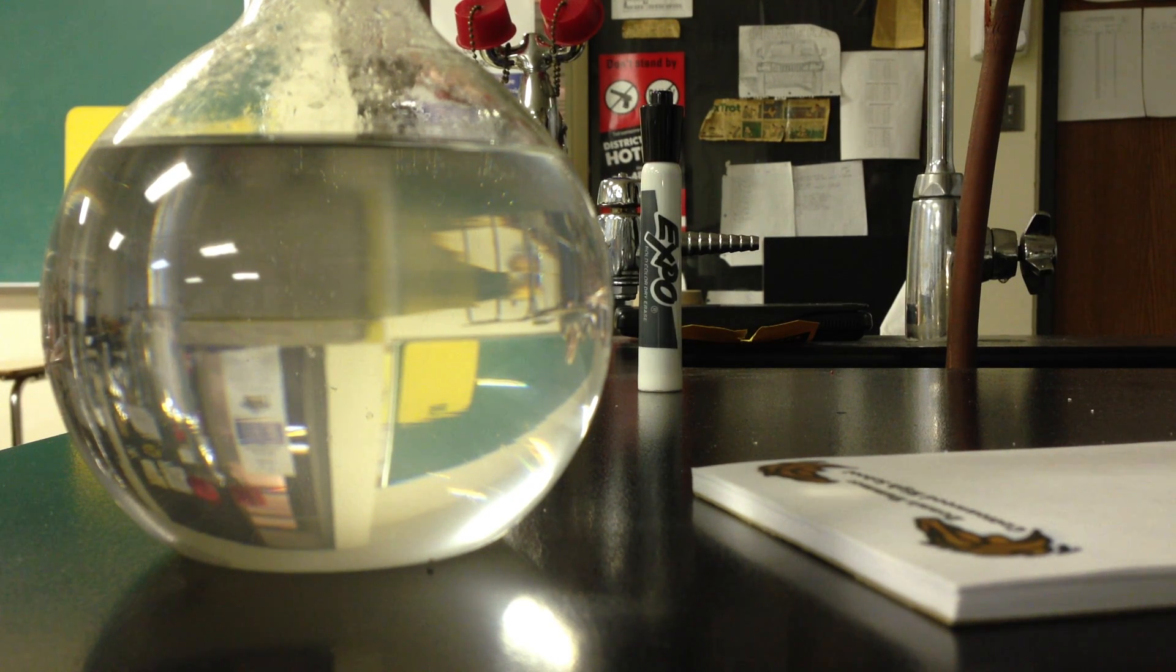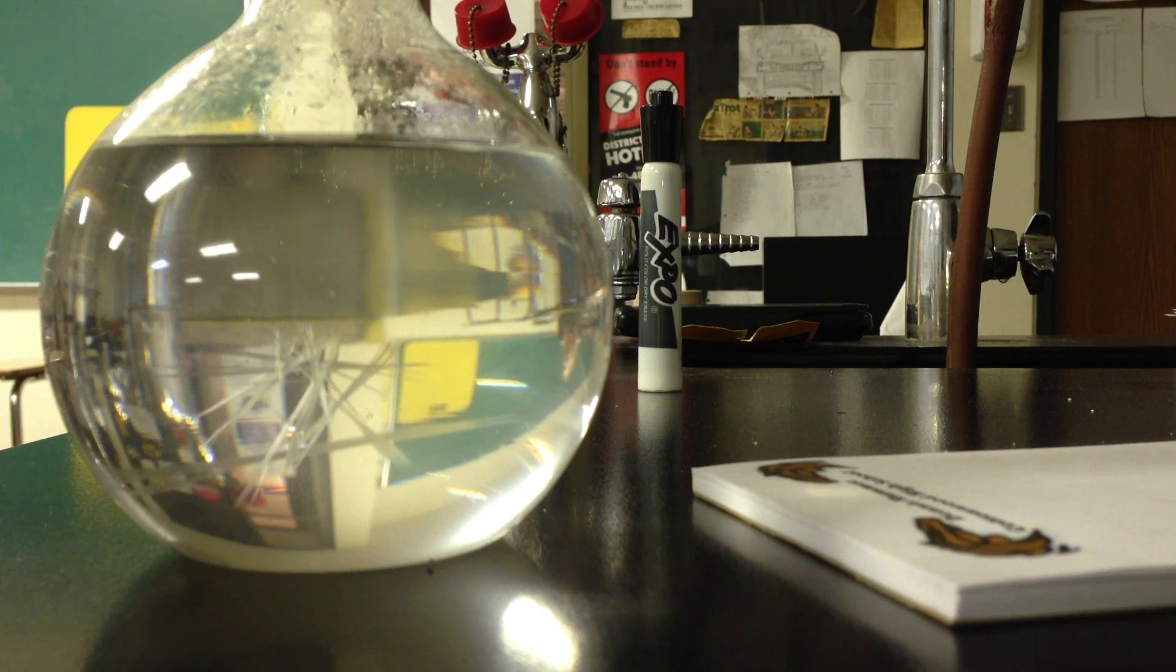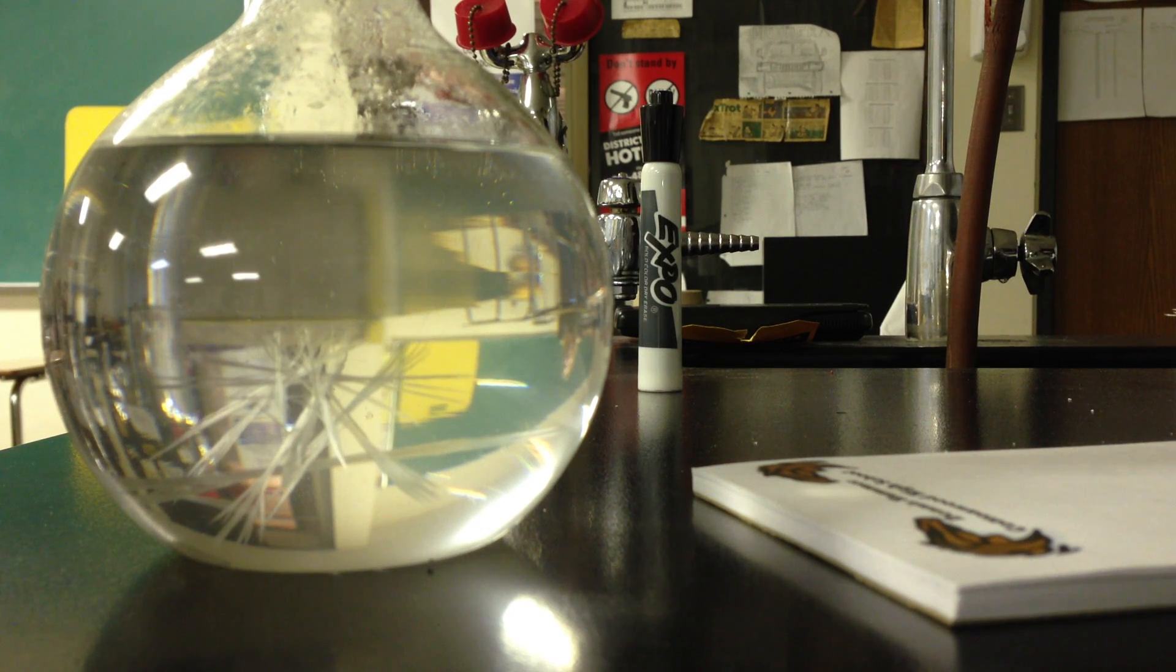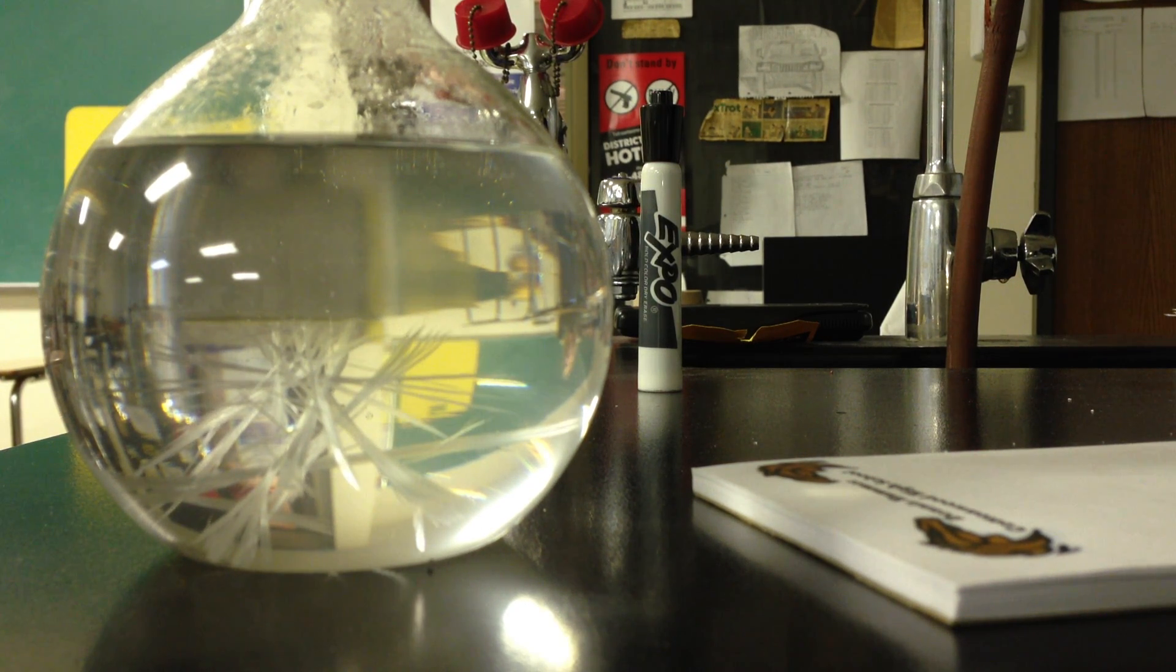And watch very carefully as that seed crystal enters the solution of supersaturated sodium acetate crystals. The sodiums and acetates recognize that crystal structure. And can you guys see the seed crystal growing?